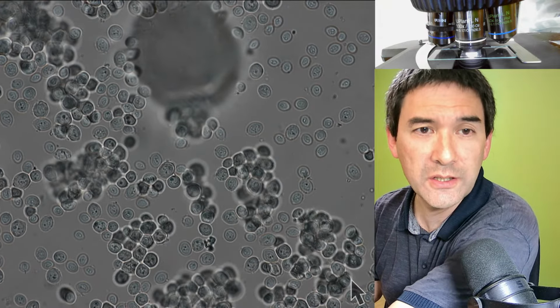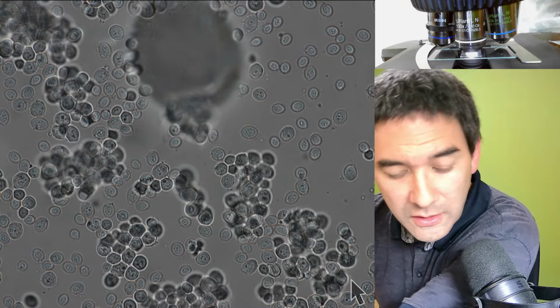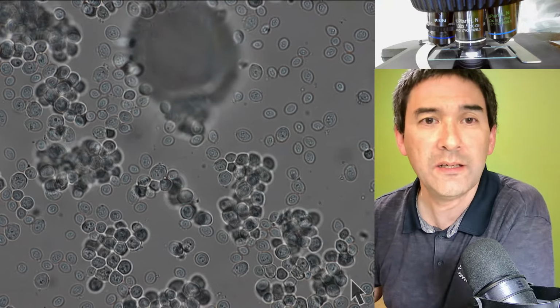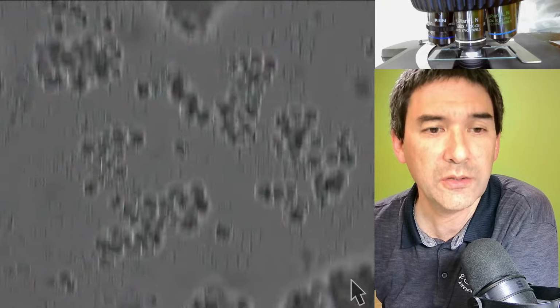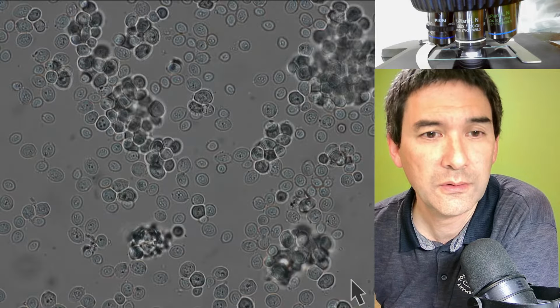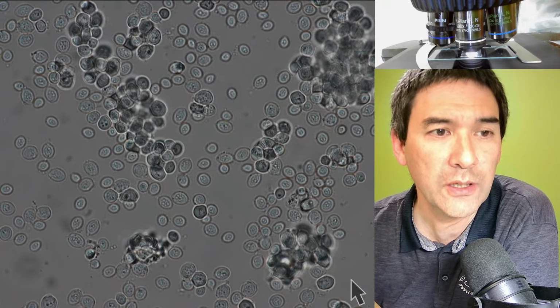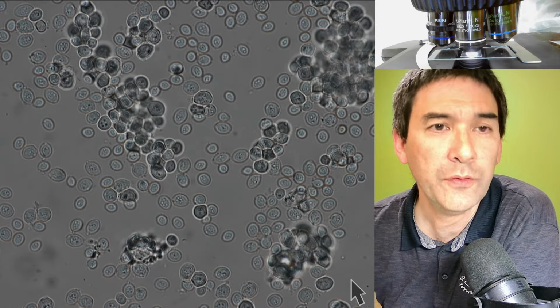Ah, okay, these are not the bacteria, these are the yeast cells that I prepared. I switched up the two petri dishes. These are basically dry yeast that I added. So these are not the bacteria like I thought, but yeast cells. Sometimes it's also quite nice to see that if you add a little bit of sugar and wait a few hours, then you might actually see some of them divide.